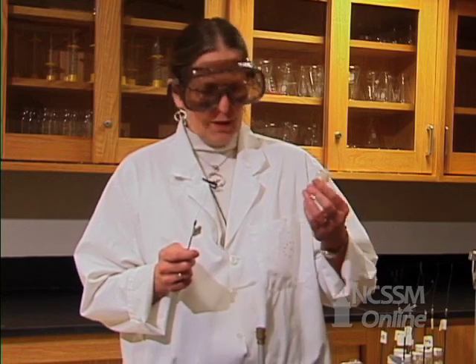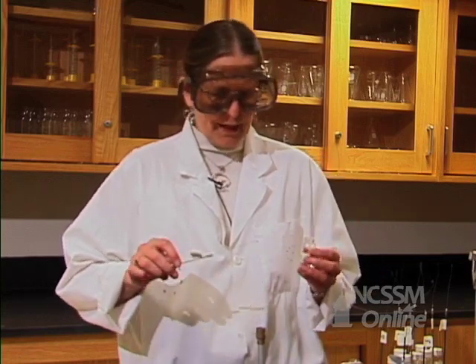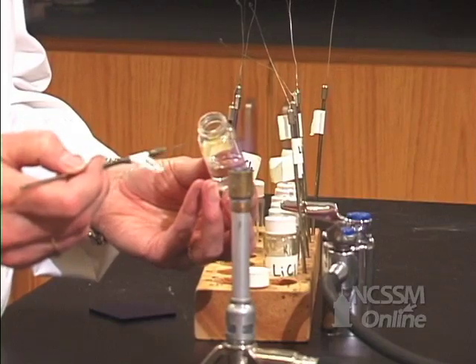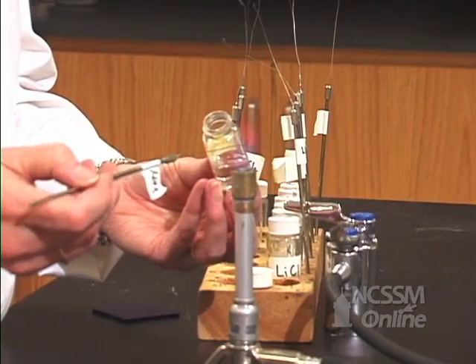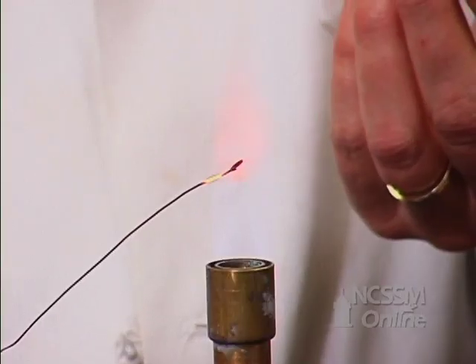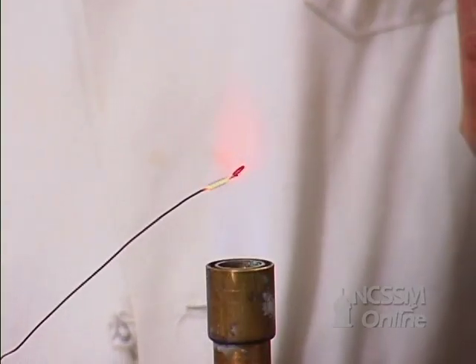What we know is that we can make fireworks. We can take salts like lithium chloride, lithium nitrate, potassium, and sodium, and we can make a different color by putting them in a fire.